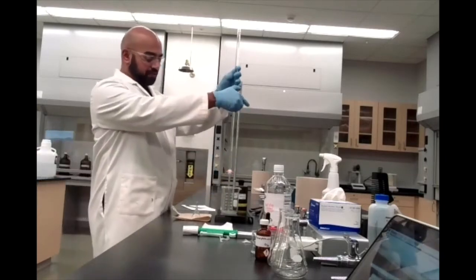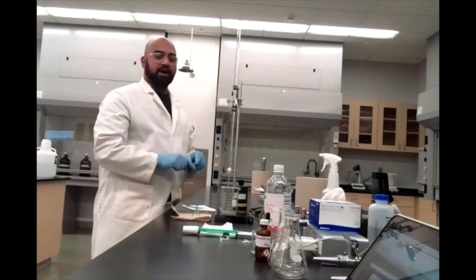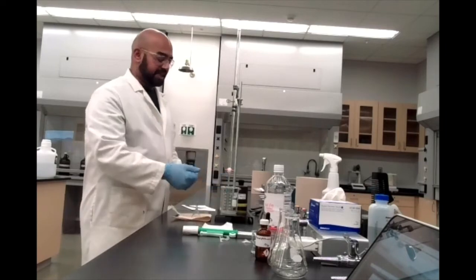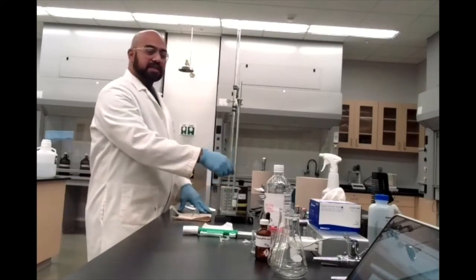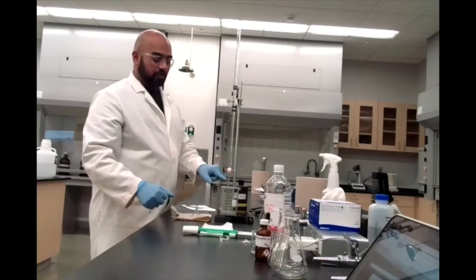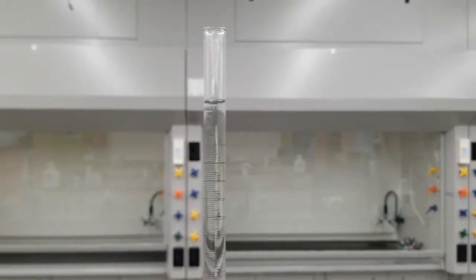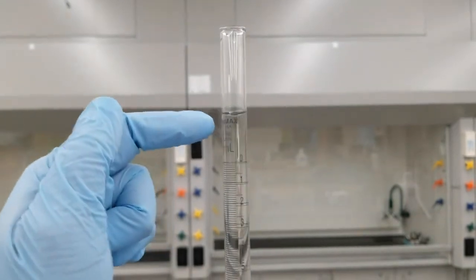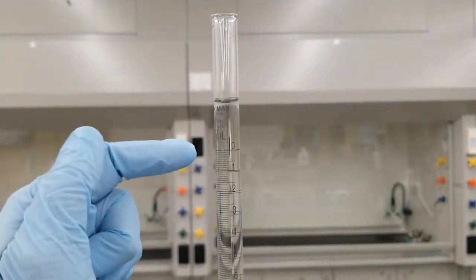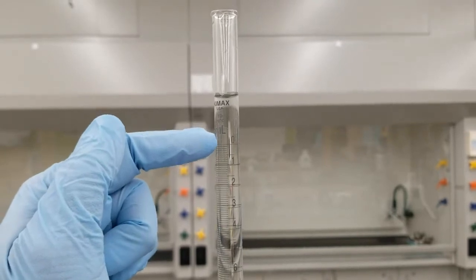So don't have that too far down, maybe just inside the opening of whatever container you're using, in this case a beaker. So I'm just going to open this up and drain out some of my sodium hydroxide, and that should hopefully get this air bubble to disappear. All right, just so you can get a better view of this, you can see here, hopefully, where I have poured my sodium hydroxide past that 0 marking on my burette.